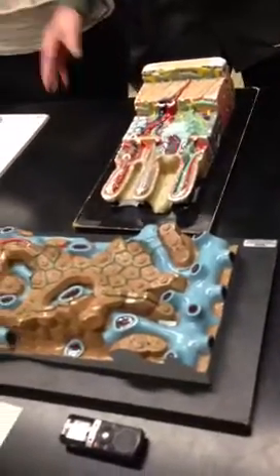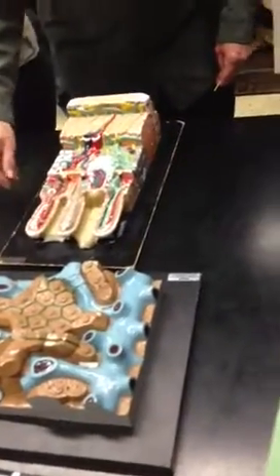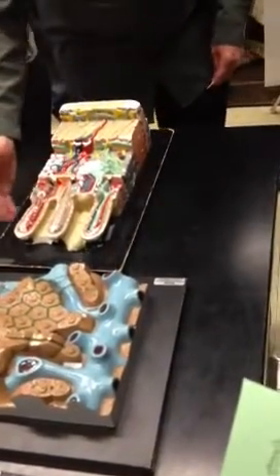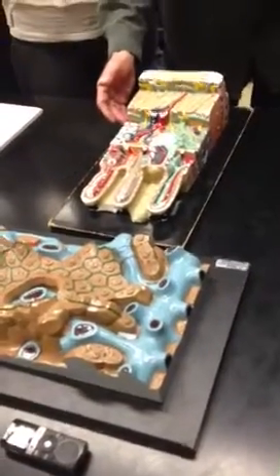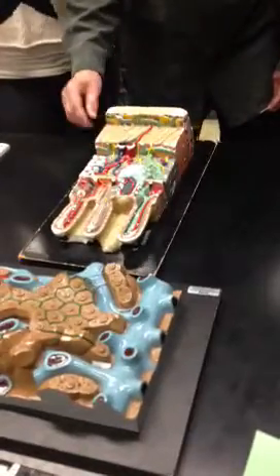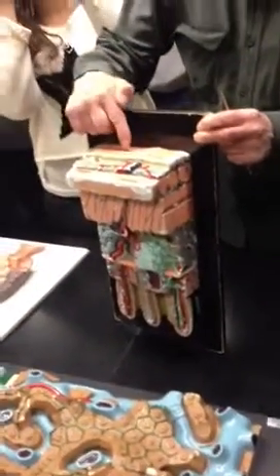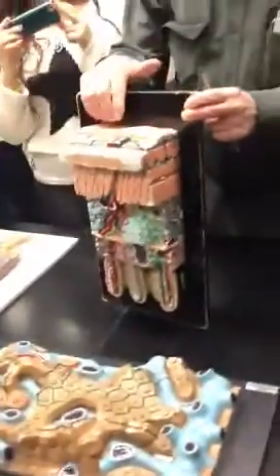And you remember that the small intestine, as well as the rest of the digestive tract, basically is made up of a mucosa, a muscularis, and a serosa. Okay, so from here up, we have mucosa. Here are muscles. Okay, so this is muscularis, and this thin serosal layer over here. You can see the flattened squamous epithelial cells making up the serous membrane right there.